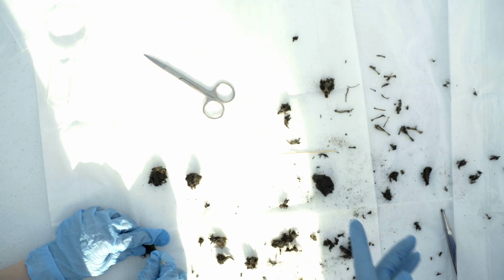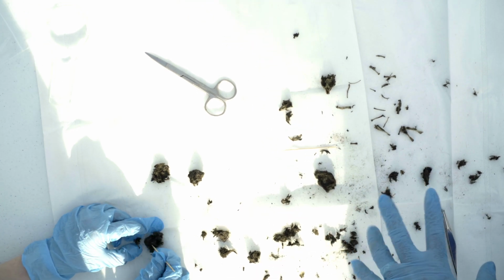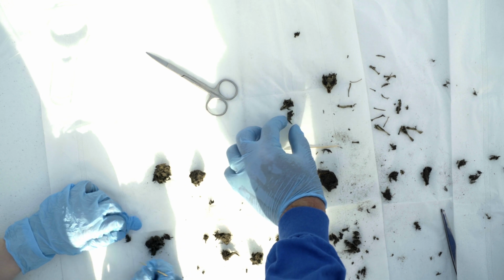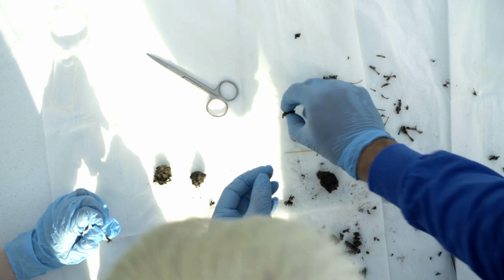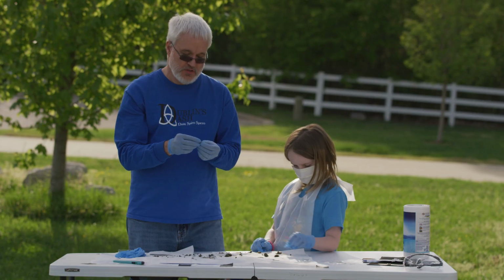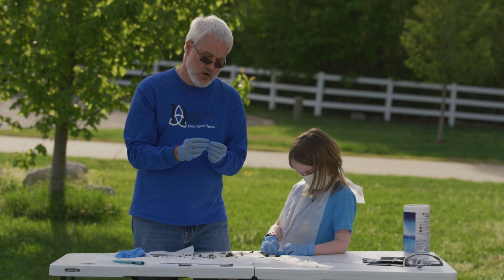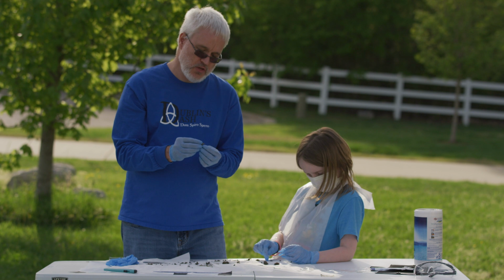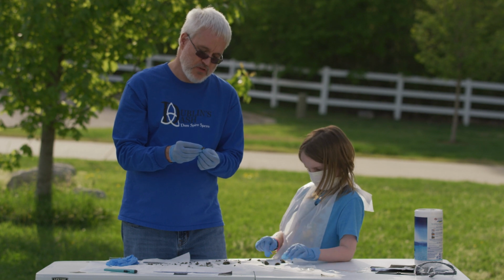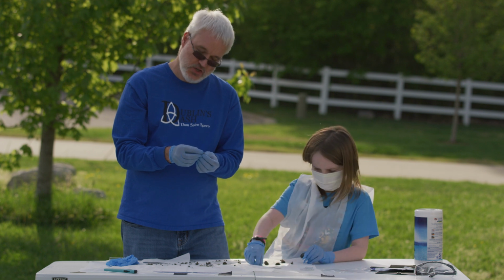So I think just looking at this particular owl pellet, we can pretty much make the assumption that this particular owl, his food web, wherever he lives, includes these little rodent guys. 2 little rodents, and by the looks of their sharp front teeth, I got more bones here. They have sharp front teeth, so these rodents most likely were meat eaters because they would use, and then they would, well, actually, no, they could use these sharper teeth to help pull roots out of the ground or seeds and crack seeds open.